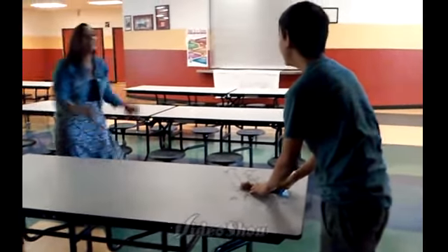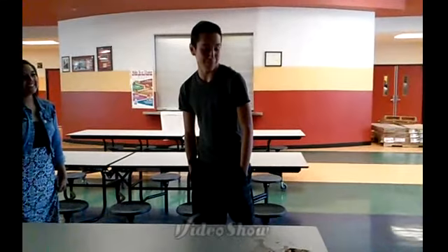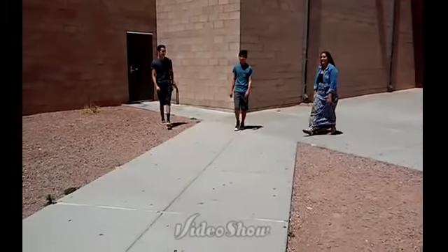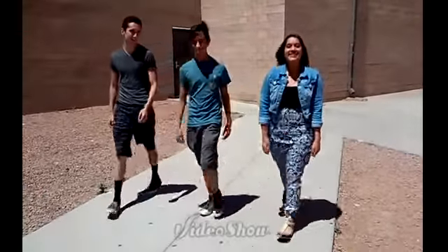Julian! Wait, Julian, you should be cleaning up! Remember, you always have to ask permission. All these procedures are for a safe lab environment. Stay safe, guys.